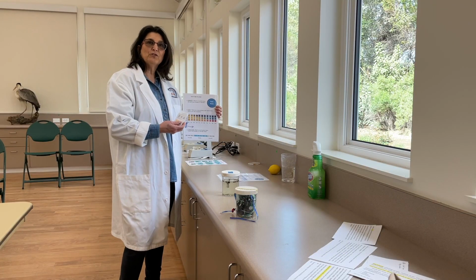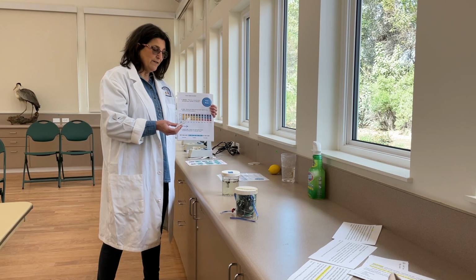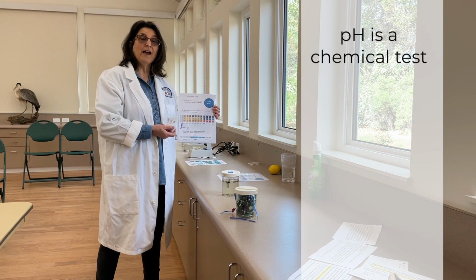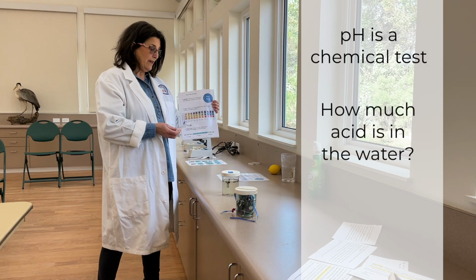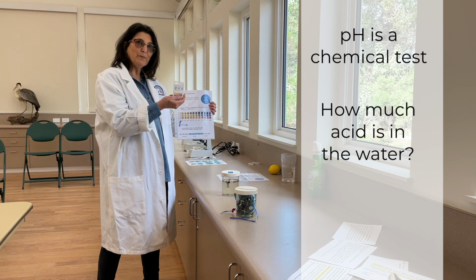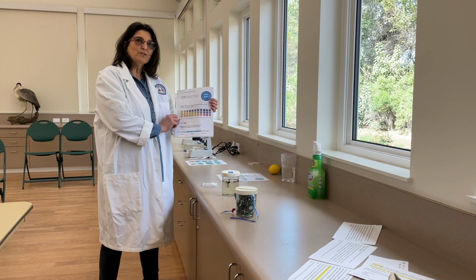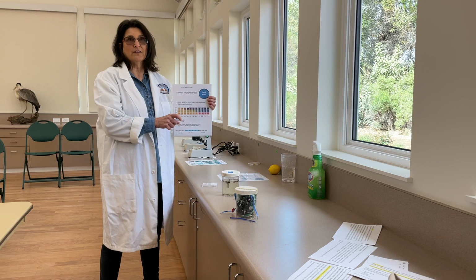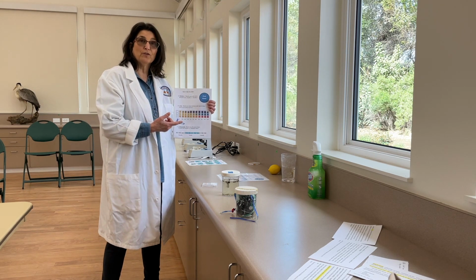So these are some of the tools that we're going to use today to test the water quality. We're going to do a test called pH. It's a chemical test to see how much acid is in the water, basically. And we use these little strips called pH strips. And what we're going to try to find out is where on a scale our water sample is. Is it in the low end? It's measured from 0 to 14.